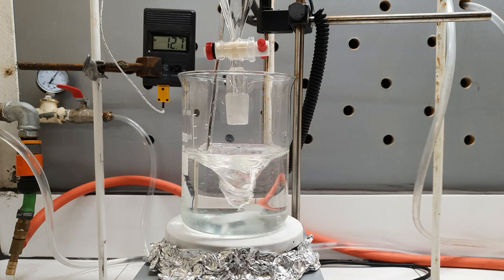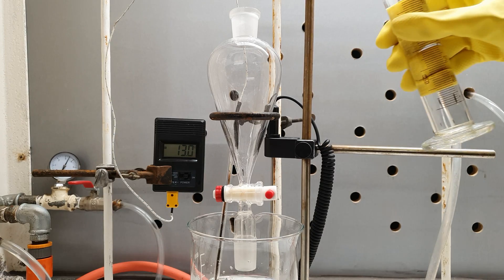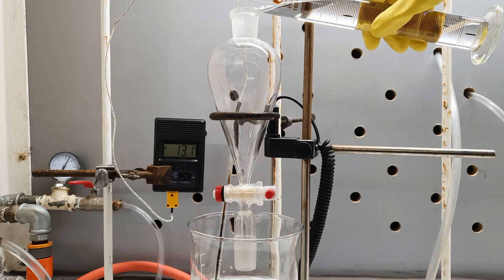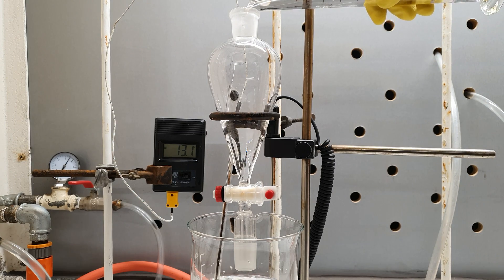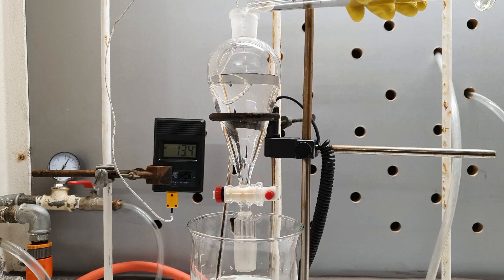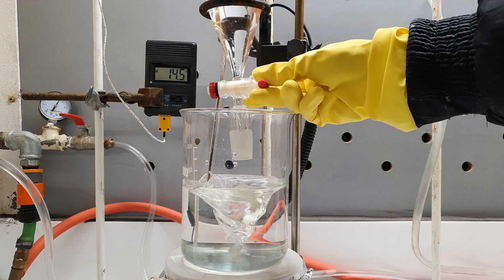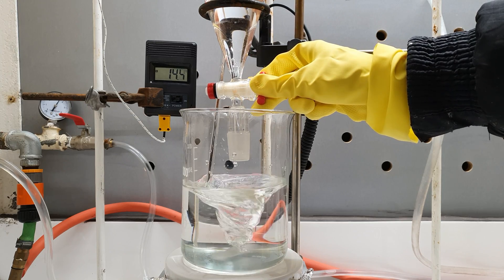When almost everything was dissolved, I put an addition funnel just above the solution. The funnel was charged with 200 milliliters of concentrated sulfuric acid. When all the bromide had dissolved, I started to add the acid drop-wise.